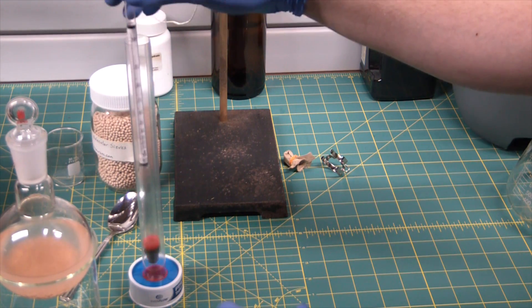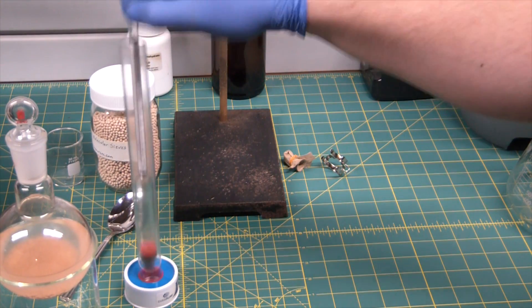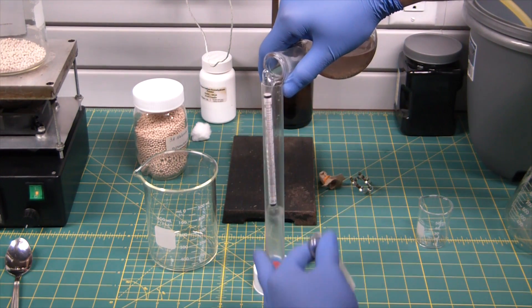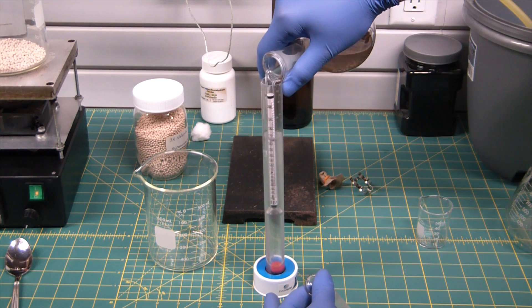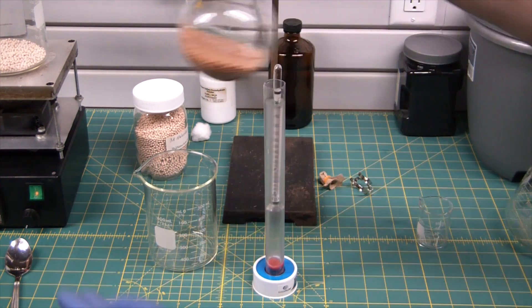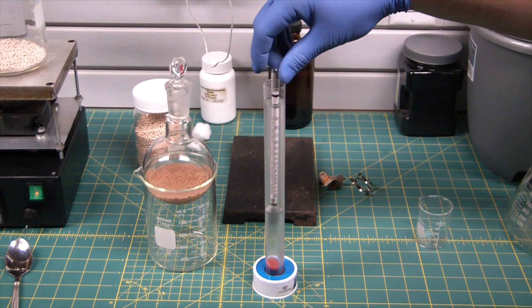Yes, this is a pretty crappy contraption here. Unfortunately my 100 milliliter graduated cylinder is not tall enough for the hydrometer here. Let's see where she's at. Woo-hoo! Right at the 200 proof, 100% mark. There we go, we did it guys! It might be cloudy but we got anhydrous ethanol from freaking table sugar. Or I mean, alcohol from the store, yes, taxes have been paid.